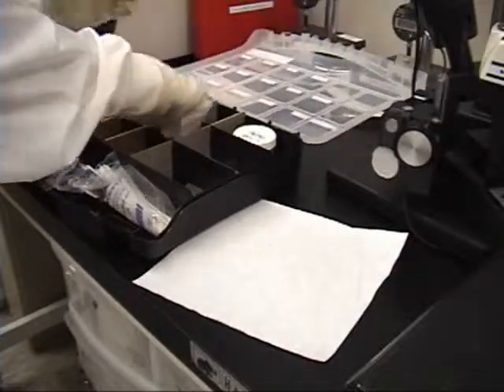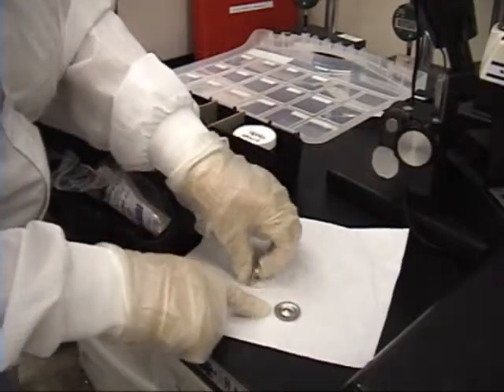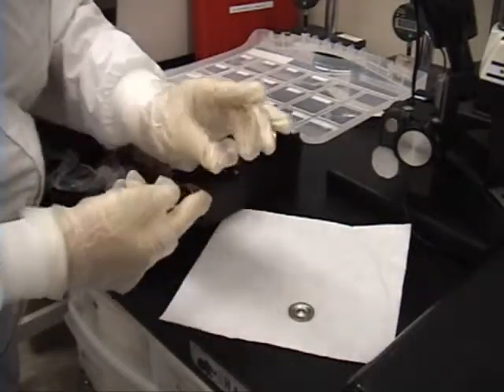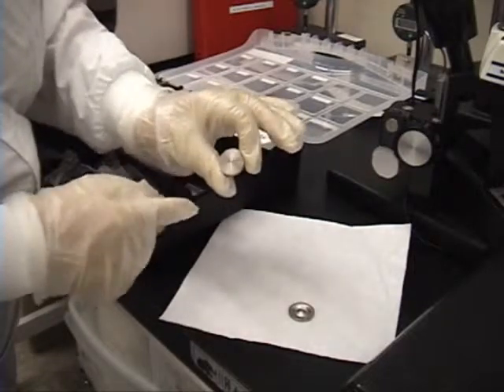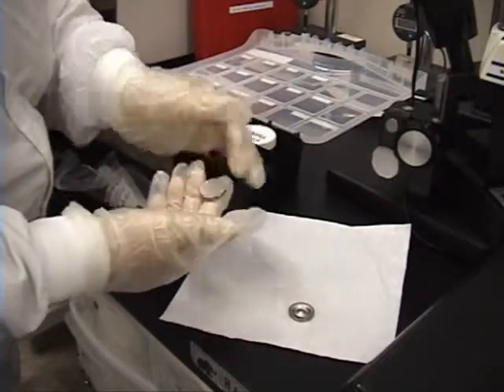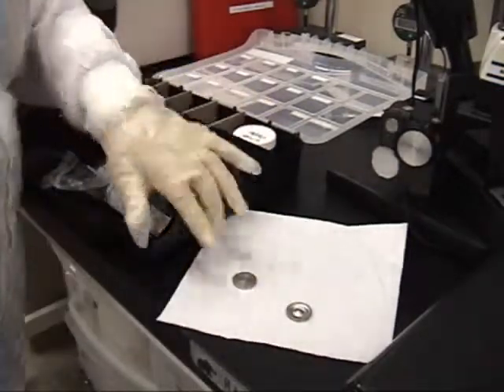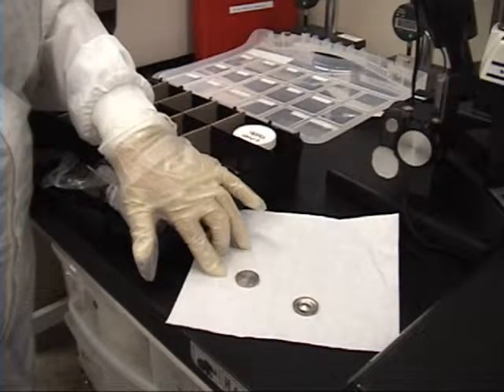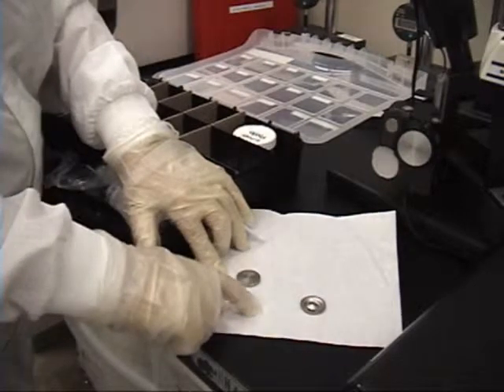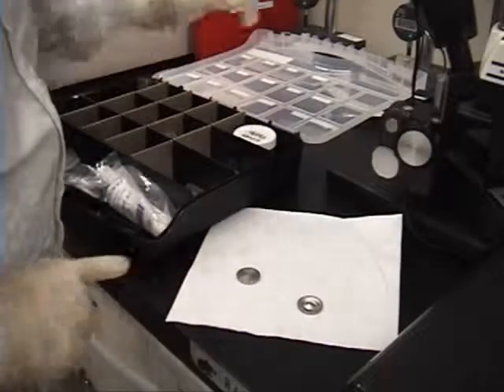In the box, we're going to be using titanium and gold. This is a used titanium; this is a brand new titanium — it's flat on both sides. Once we bring in a new target, we scribe the back when it's silver in color. So the scribe on this one says TI, and I am going to use this as my front. These are one inch in diameter, one eighth of an inch thick. You cannot let it go below the thickness in the deepest area any deeper than 0.02 inches using a drop-down gauge.